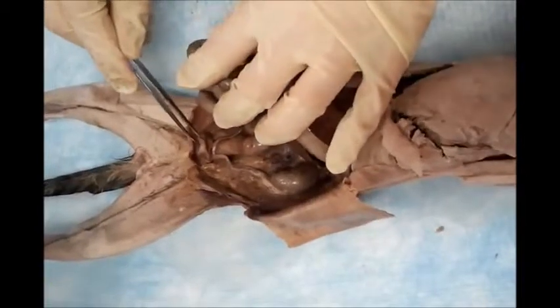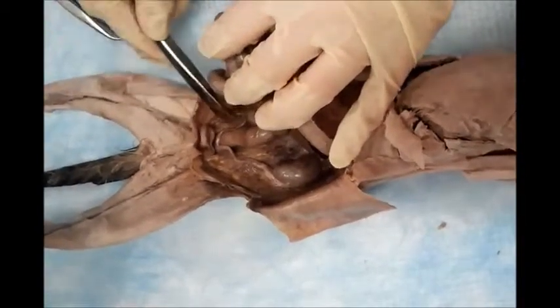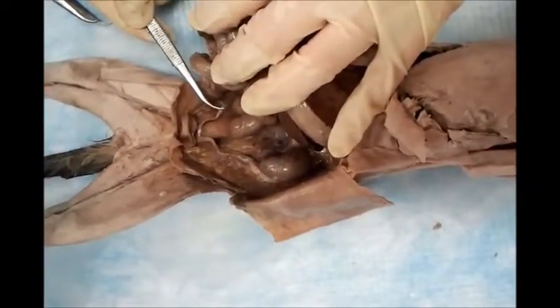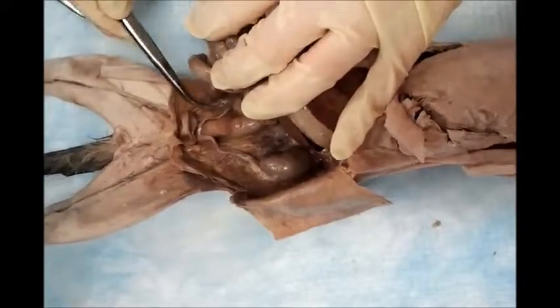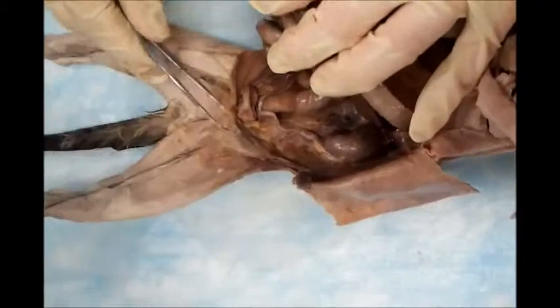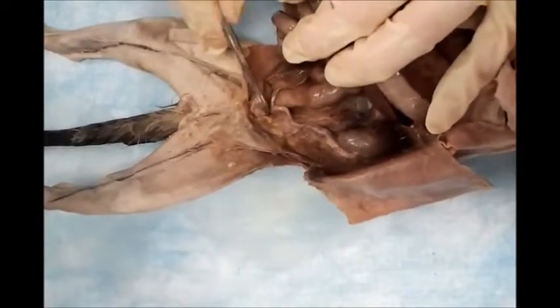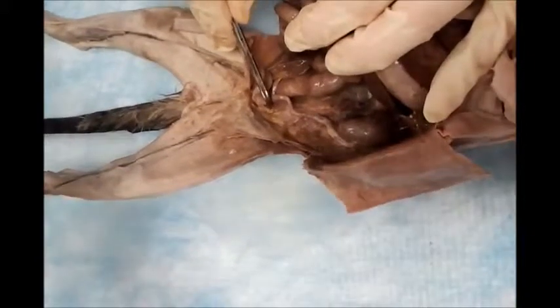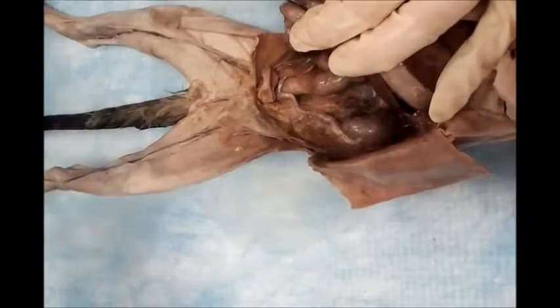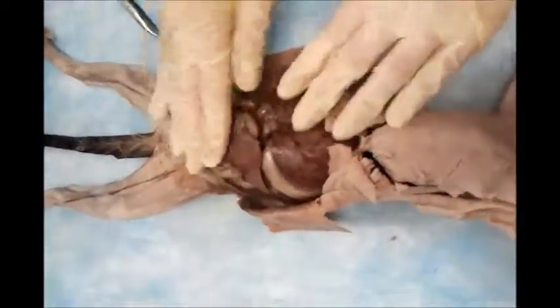It's a cavity that can hold the urine. Can you see the other ureter running on the other side? Here you go. So we have a very clearly dissected urinary system in this cat. This is a female cat, so we can also find the two ovaries, one on each side, and the uterus should be in the back of the urinary bladder, which is not clear in this cat. These are all systems you need to know in this second half of your semester.